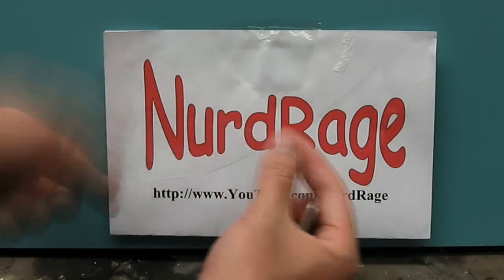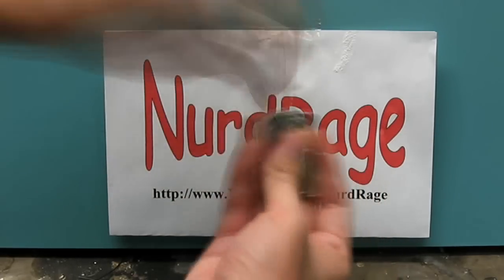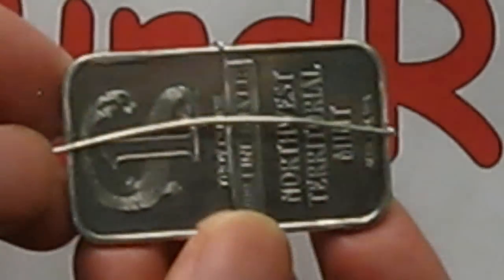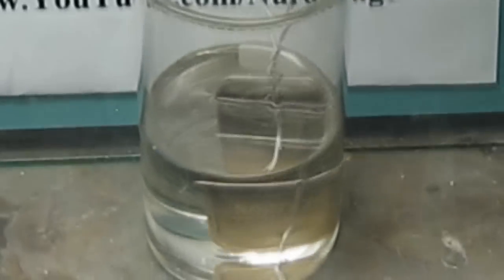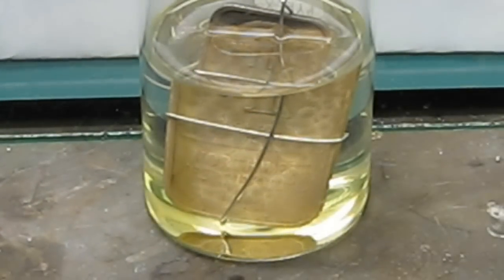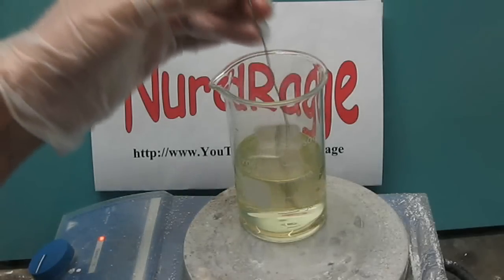To better control what we're doing, we're going to wrap the bar in aluminum wire. Aluminum is resistant to the corrosive effects of concentrated nitric acid. Now we dip the silver into concentrated nitric acid, but since it's cold, the reaction is proceeding very slowly. We've time-lapsed this video over an hour to show you just how slow it is.